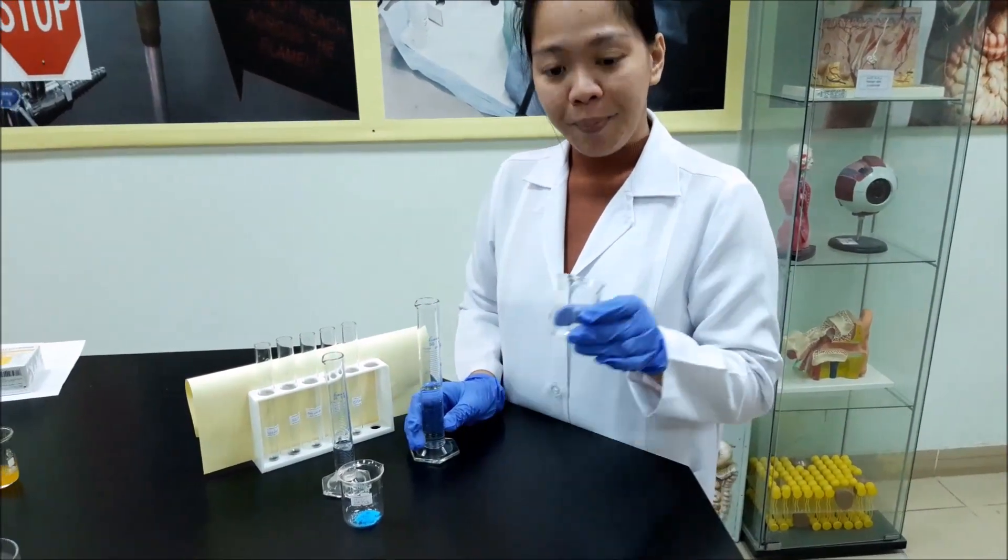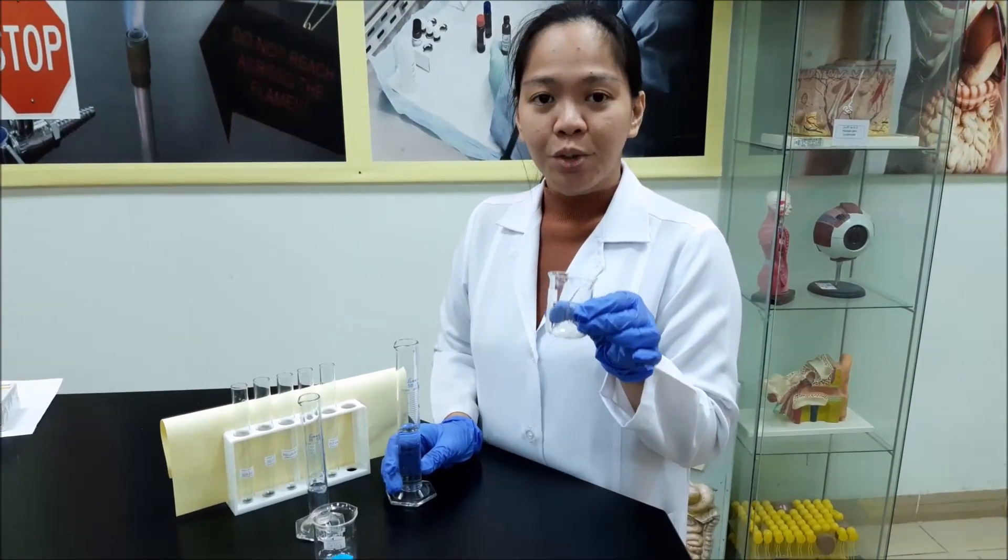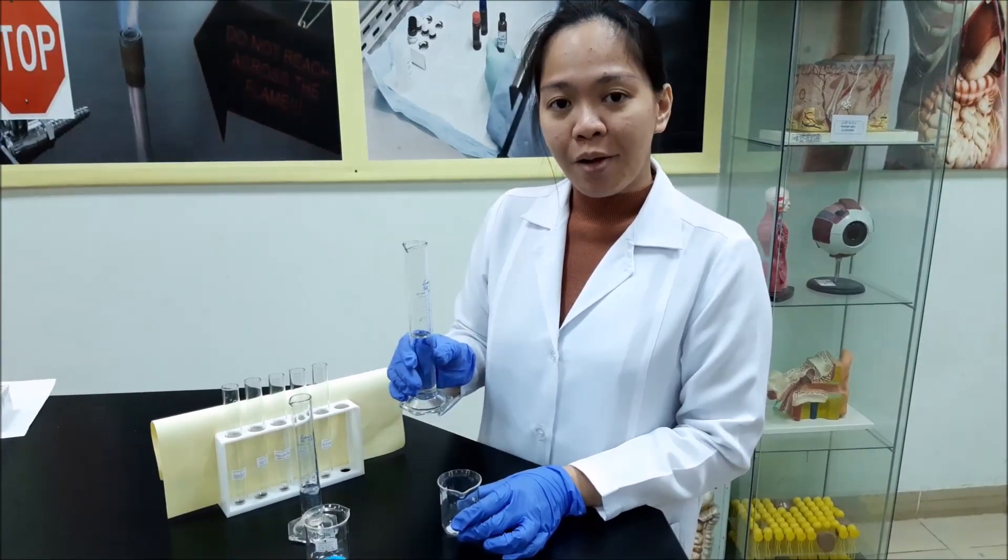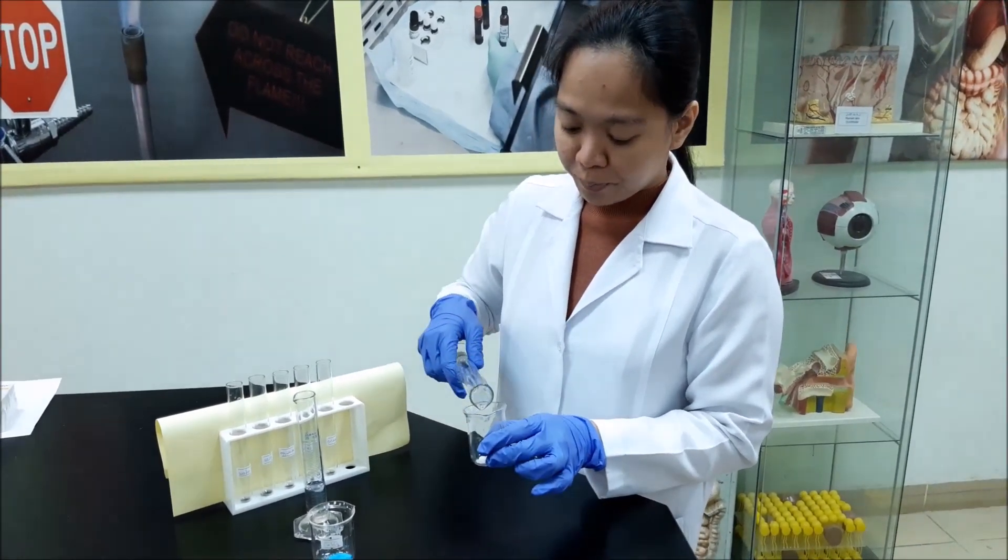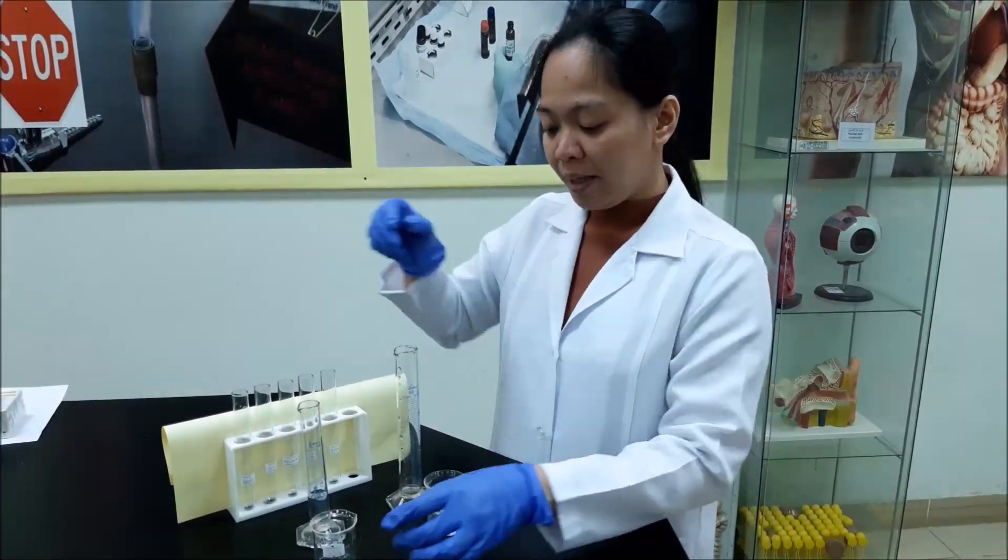So in here, I prepared 2 grams of sodium hydroxide and we will dissolve it in 30 ml of water. And let it dissolve completely.